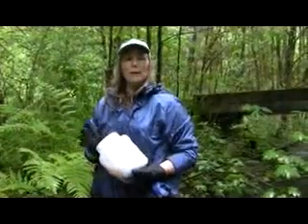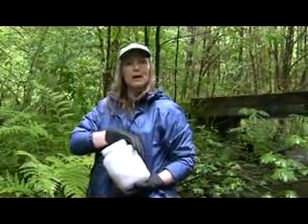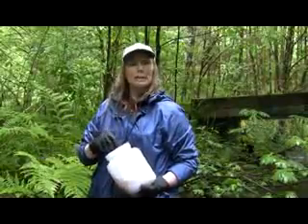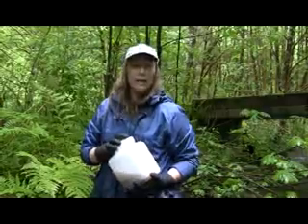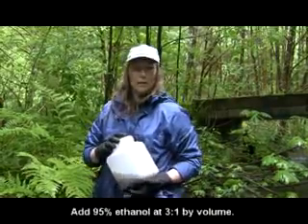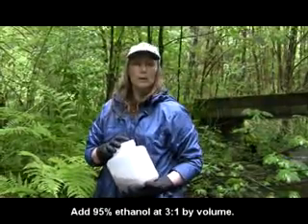So now we've got our sample in our jar. We have the outer label affixed to the outside. We've placed the inner label inside the sample just in case something happens to the outer label. And we use 95% non-denatured ethanol as our preservative. So you're going to mix 3 parts preservative with 1 part sample.